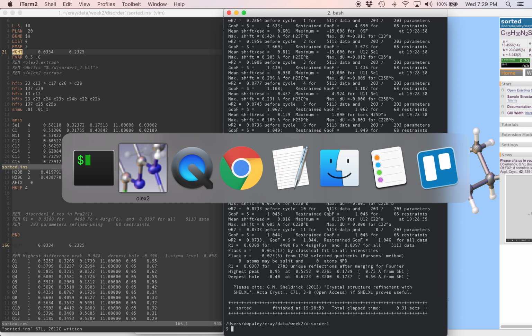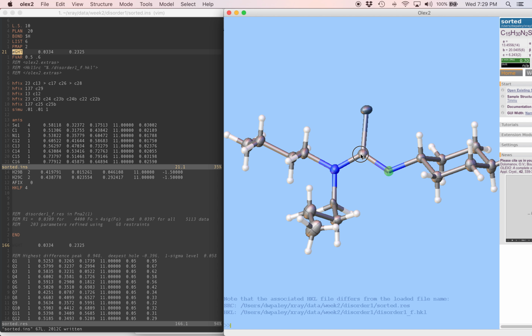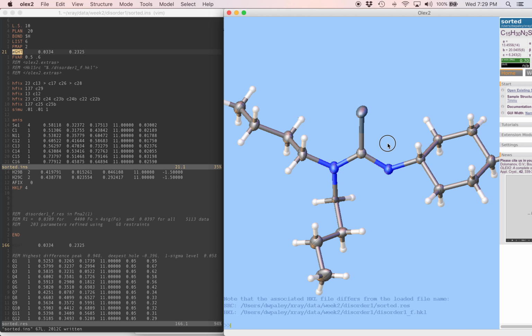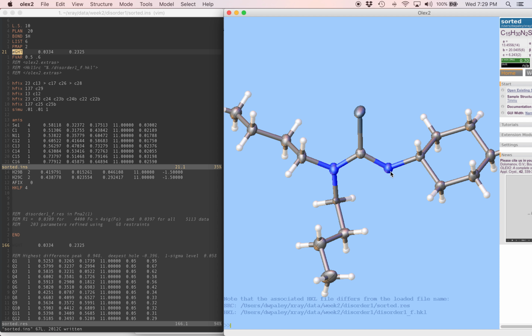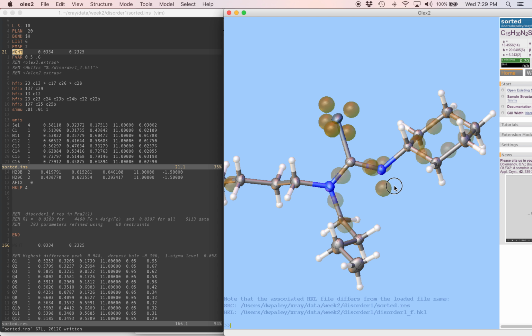I forgot an atom. What's going on with this nitrogen here? This is only bonded to 2 things, and theoretically it should be an sp3-ish nitrogen, although it's part of a selenocarbonyl, so we know it's going to be planar-ish. But at the same time, it should have a third atom attached to it, and we know that that should be a hydrogen atom. We can see in the difference map there clearly is a hydrogen there.